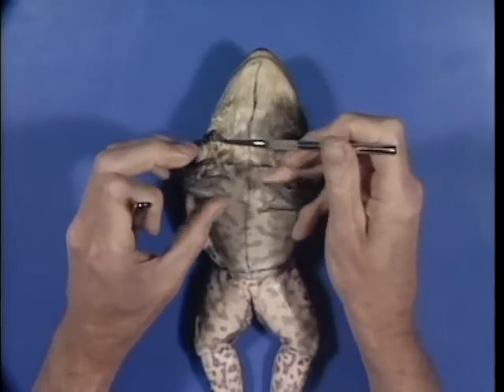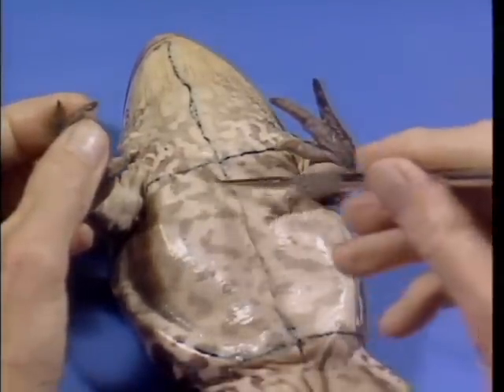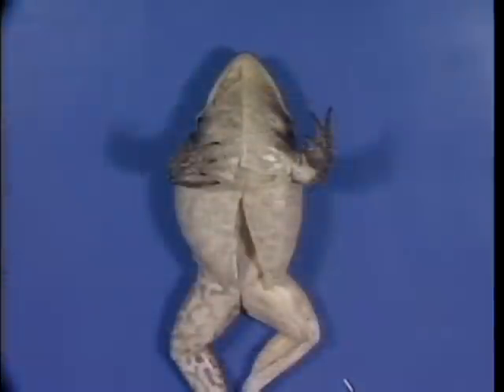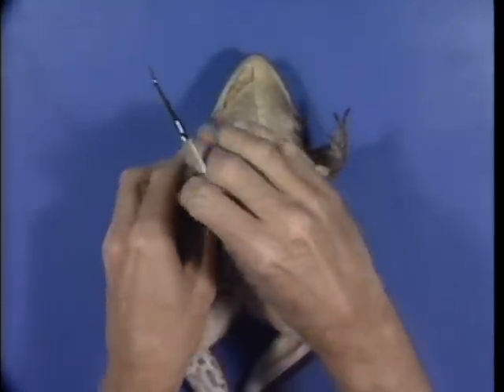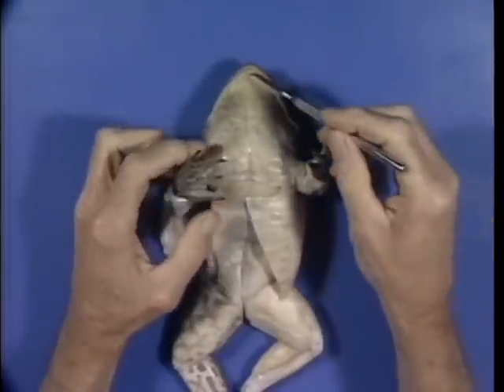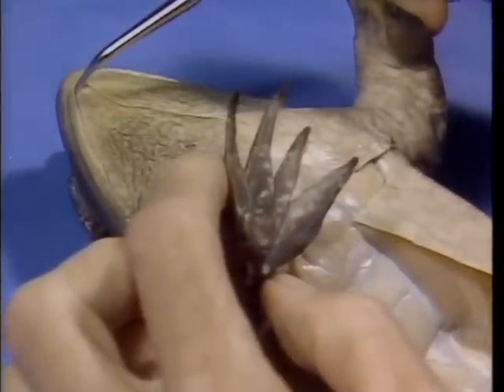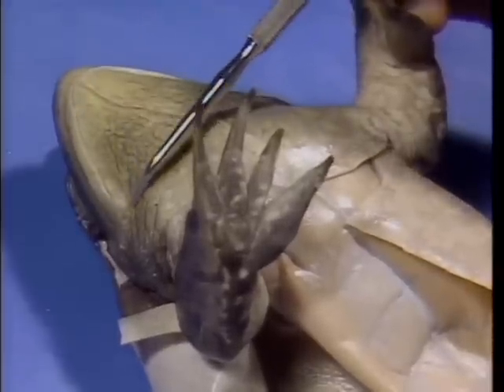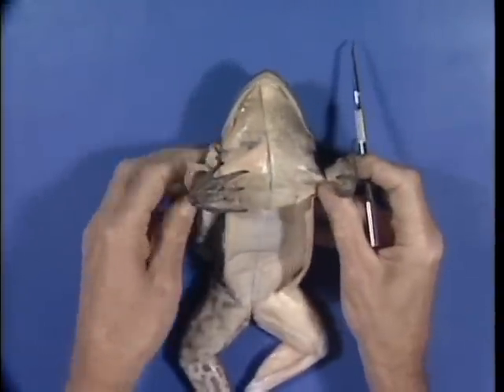Complete the process by cutting transversely across the chest, just posterior to the front limbs. Do the same just anterior to the hind limbs. Now pull the skin away from the underlying muscles on the right side of the frog, as seen here to the left side of your screen. One more cut is necessary before we begin to observe the muscles on the ventral surface. Use a scalpel or scissors to cut along the lower lip from the center following the outer margin of the chin on the right side. Pinning or holding the skin aside will make it easier to identify muscles.